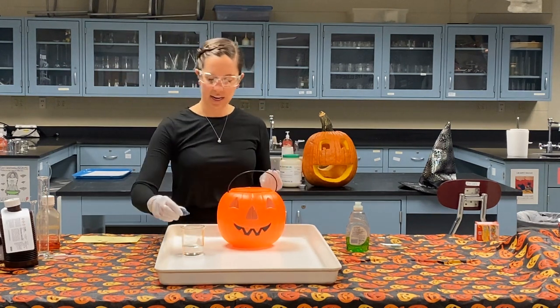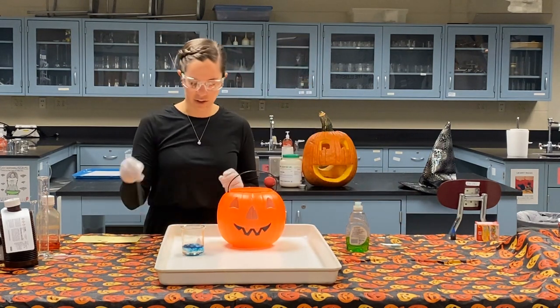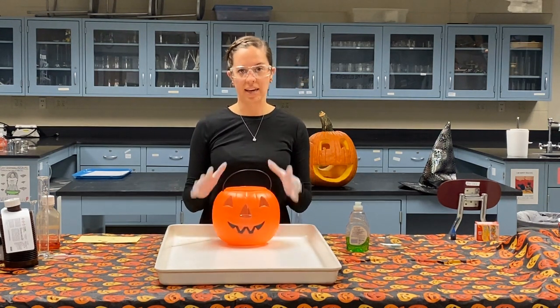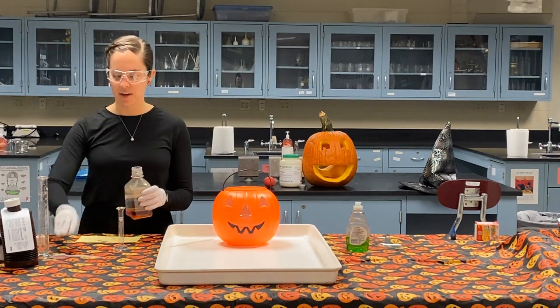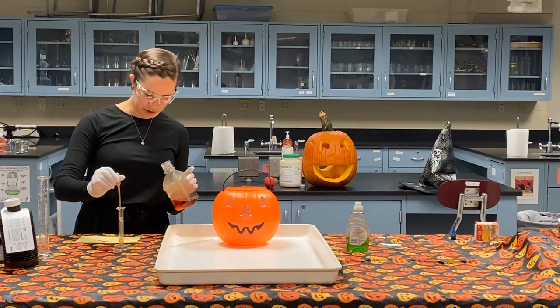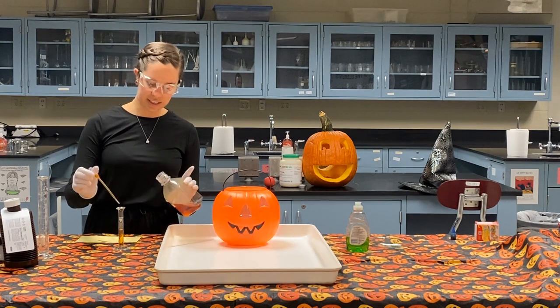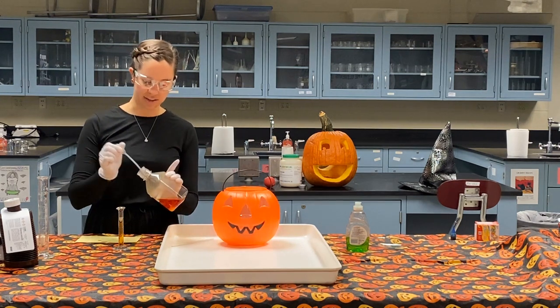Now, I'm gonna add some blue food coloring purely just for visual effect. It has really no effect on the chemical reaction. I'm gonna stir that up here just to get some nice blue foam. That'll be the goal. Now I'm gonna put that here inside my pumpkin. Now, in this case, we are still going to catalyze this reaction, but instead of using manganese dioxide, which is a solid catalyst like we did in the last demo, we're going to use potassium iodide, which is an aqueous solution. I'm going to put that here, measure that out. And again, this catalyst essentially kickstarts the reaction. So it's going to make this decomposition reaction happen much, much faster, okay?